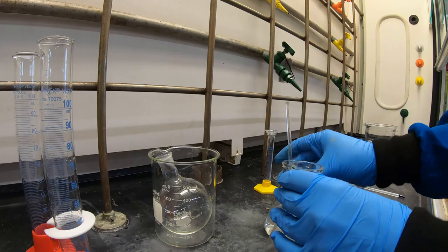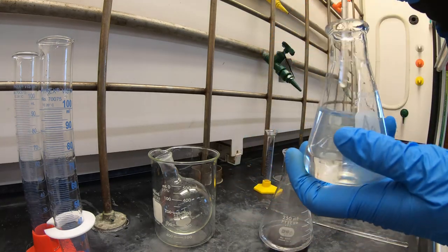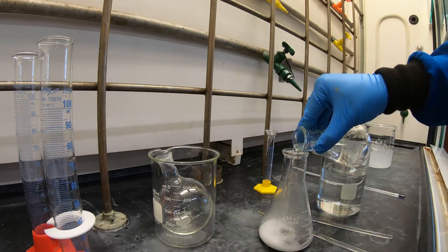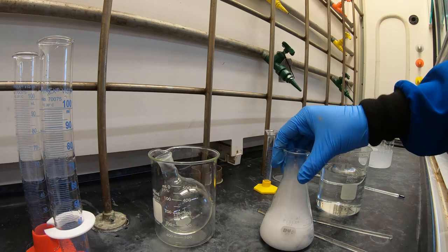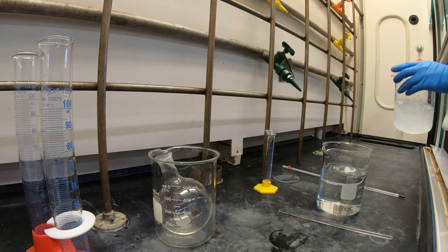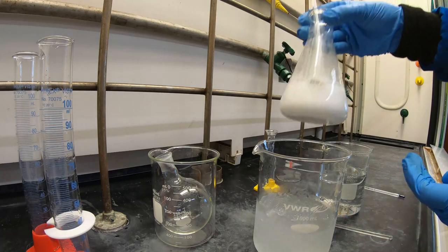Now add the sodium acetate solution directly to the flask containing the alpha chloroacetyl chloride solution. You will immediately see a formation of smoke and white solid. Place the flask in an ice water bath and cool for at least 15 minutes.